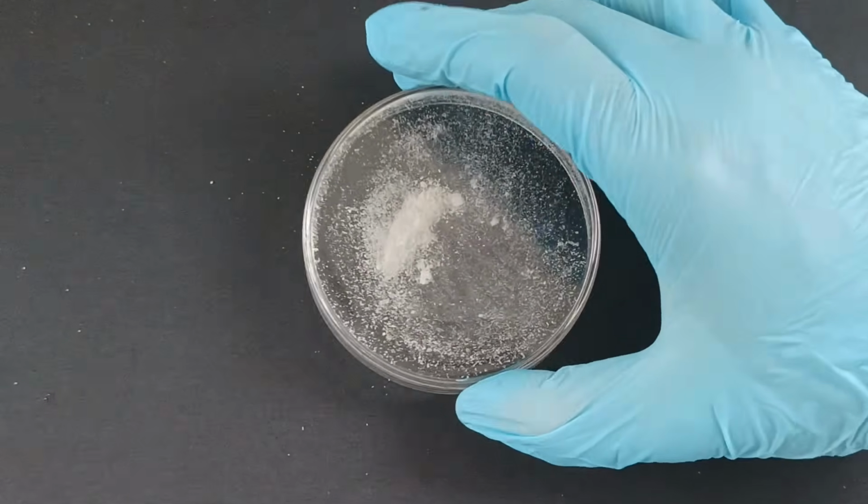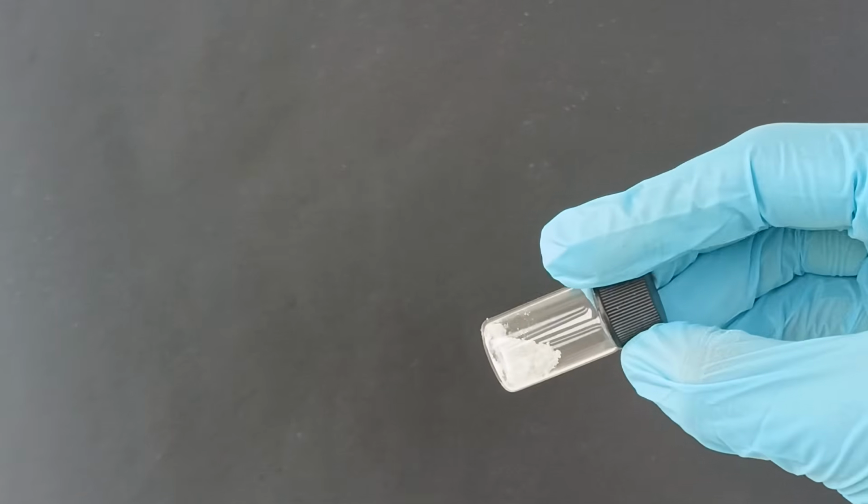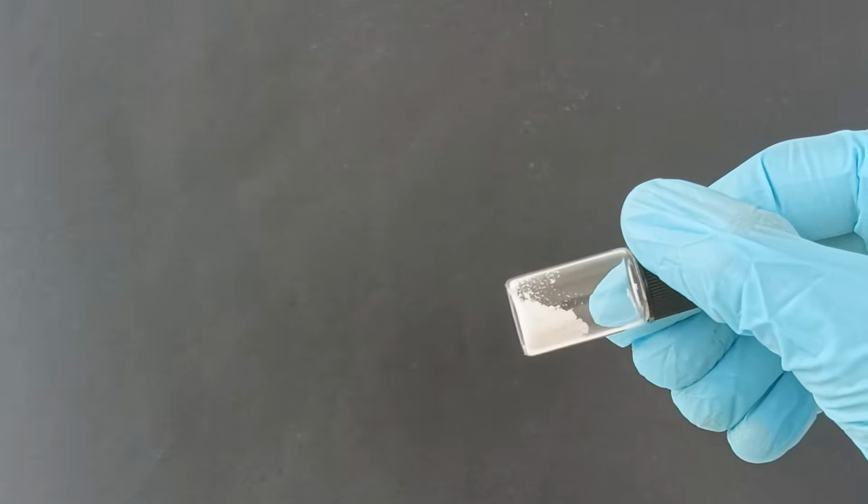The toluene crystallization managed to remove the precipitated brown colored impurity, allowing me to filter it off before recrystallizing, which greatly helped purify the product and makes it kinda sad that I didn't record it.